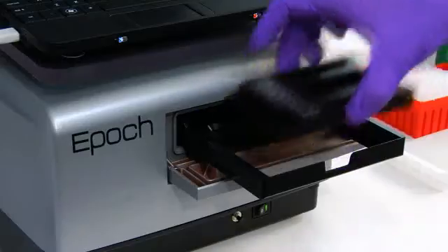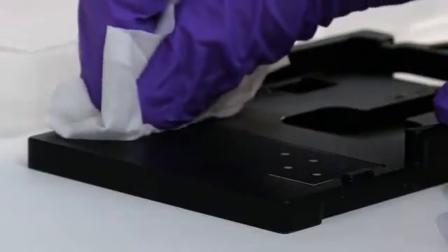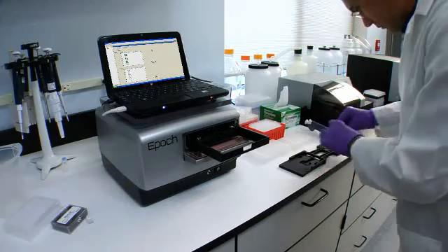After the blanks are read, the Take 3 plate is removed and the blanks are wiped off both top and bottom slides with a lab wipe.